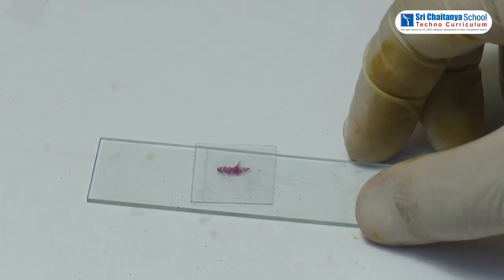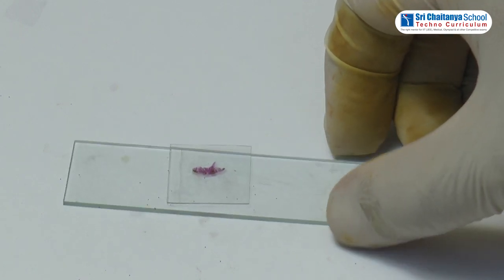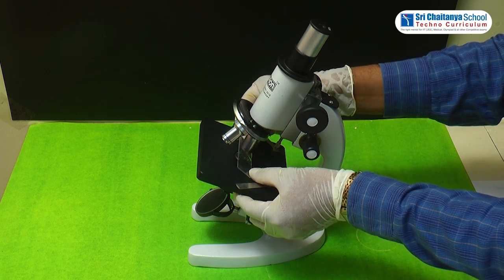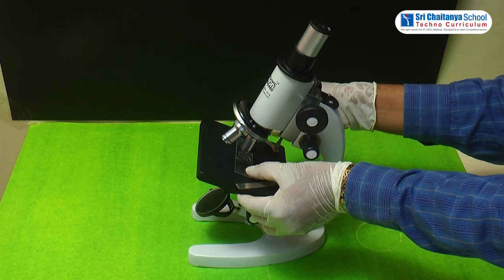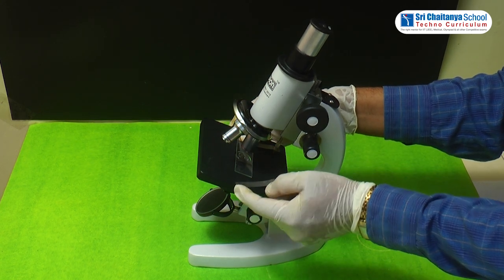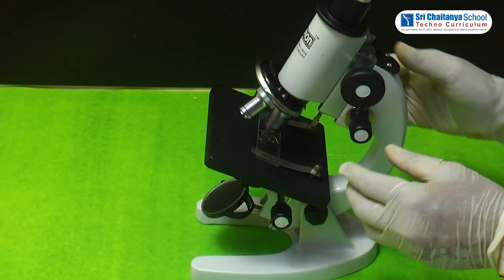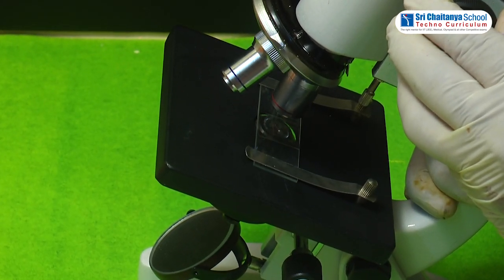Place the slide under the microscope and hold the glass slide with the clips. Now observe the specimen under the microscope.